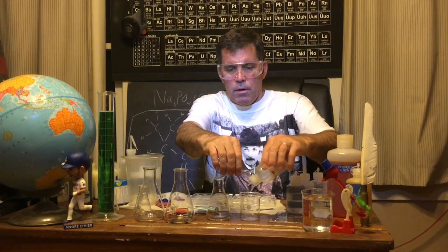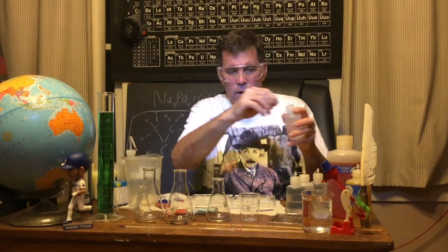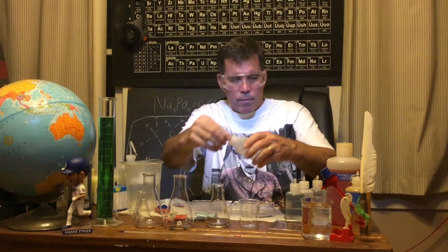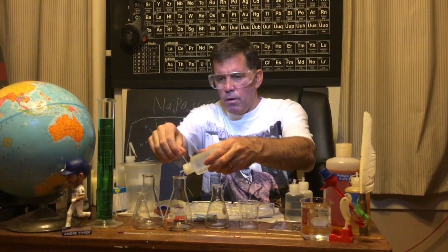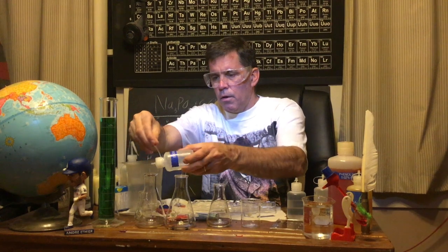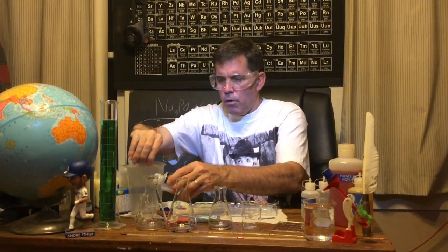So in this first beaker, that's acetic acid. Here's hydrochloric acid. Here's sodium chloride. Here's sodium hydroxide. And here's the ammonia.